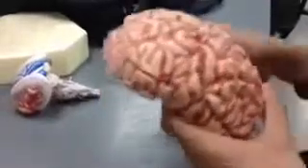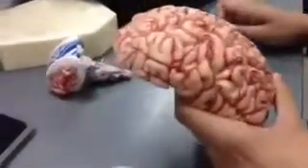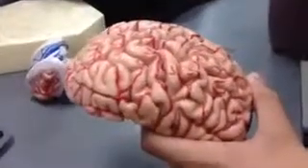Okay, so handout number 9, brain and cranial nerves, November 26, 1851 hours. So we'll begin with the cerebrum.